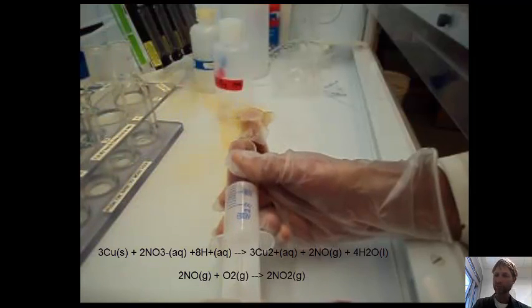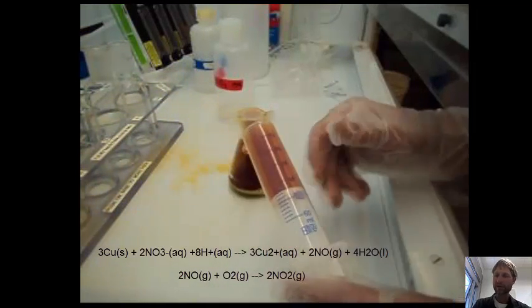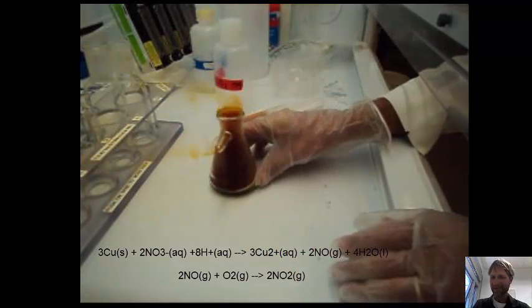Now, of course, I'm doing this in the fume hood. You can see I'm wearing gloves, and I'm wearing a lab coat, and the bench top is relatively clean. There is some clutter in there, but we do our best.